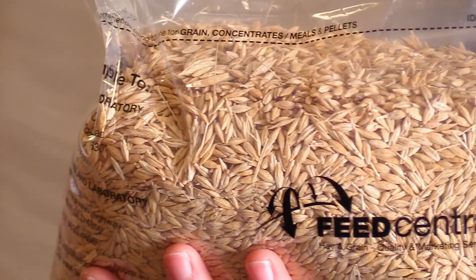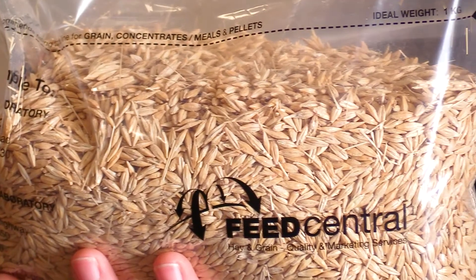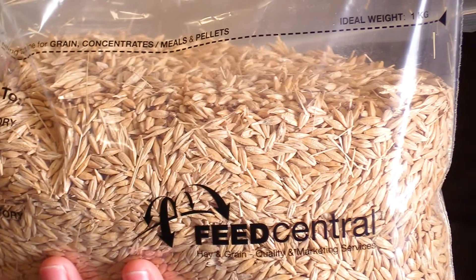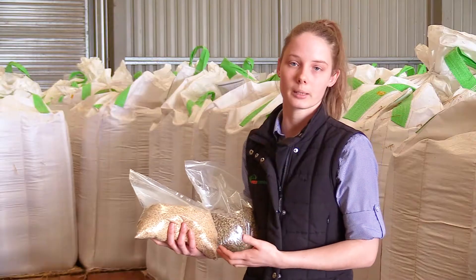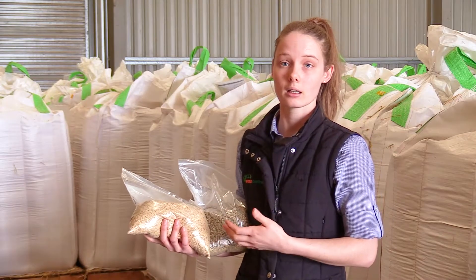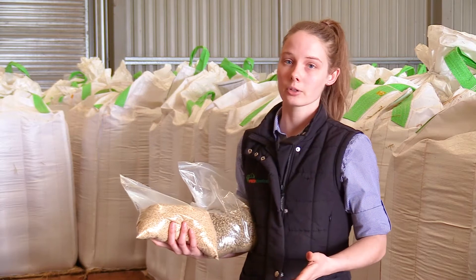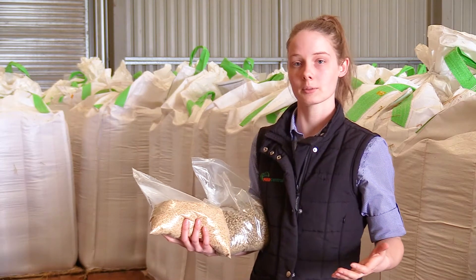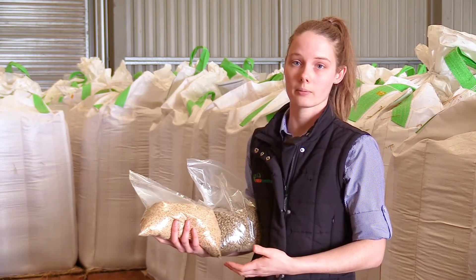The recommended sample size for a grain or pellet is about a kilo. If you've collected a larger sample than that, we recommend that you look on our website on how to subsample or view the video.